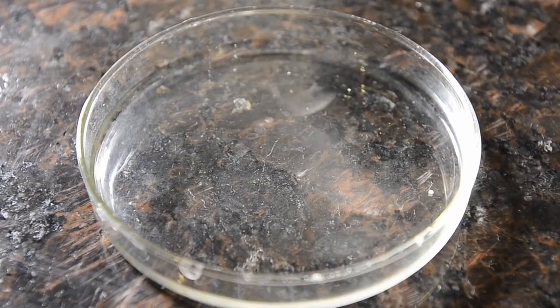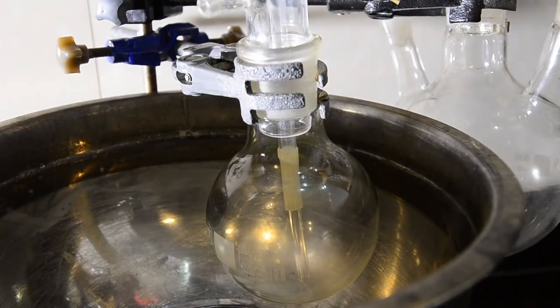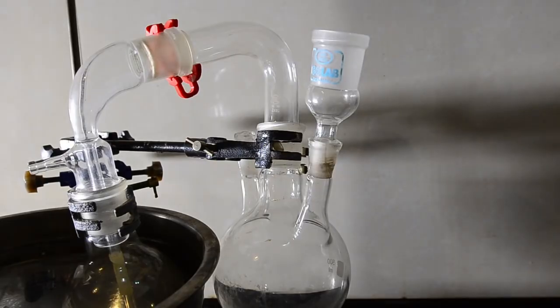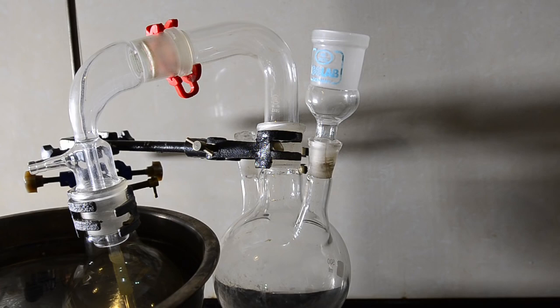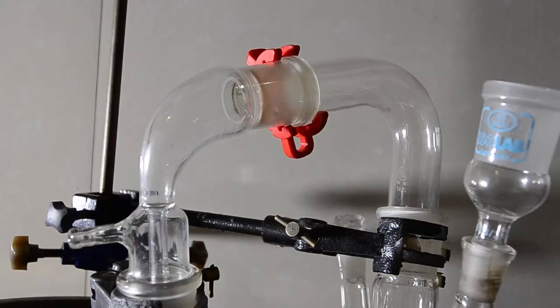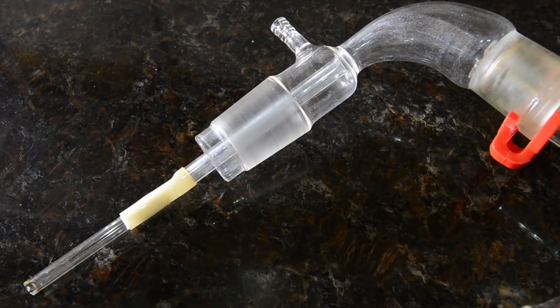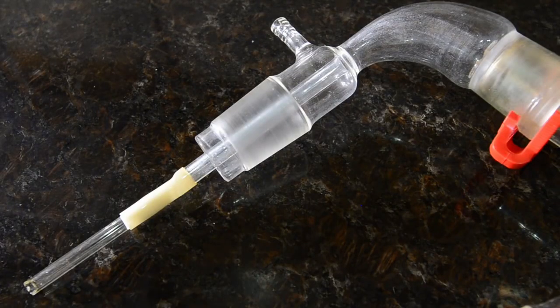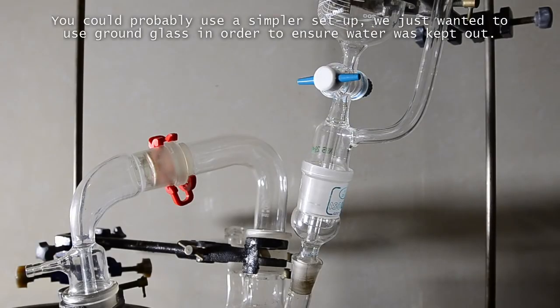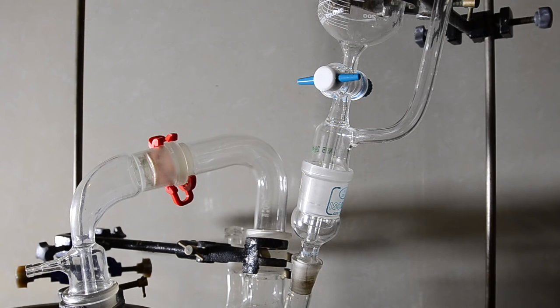We assembled an apparatus to slowly generate HCl gas and bubble it through the liquid mixture, whilst suspended in an ice bath and completely closed to the atmosphere. We used a distillation adapter, some PTFE tape, and a small glass tube, which worked well. We added an addition funnel so that we could add sulfuric acid slowly to sodium chloride to generate our HCl gas.